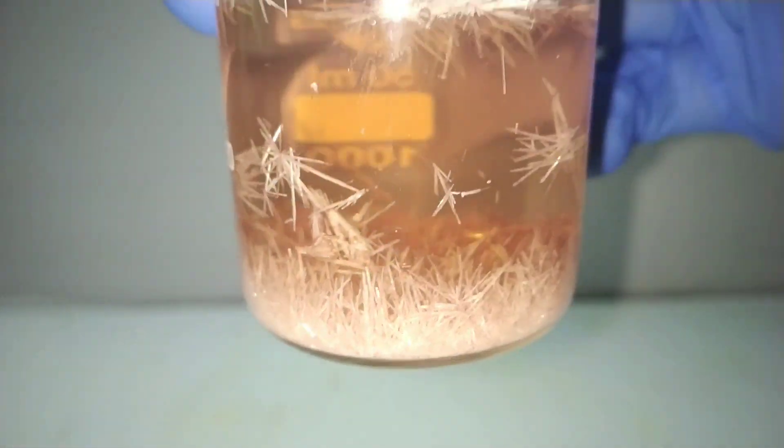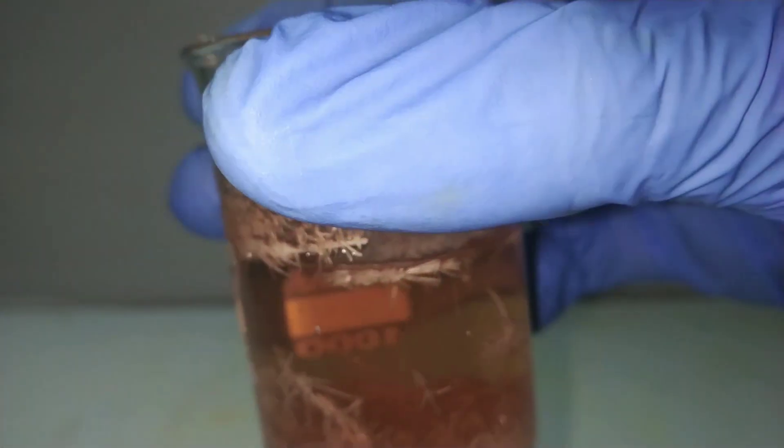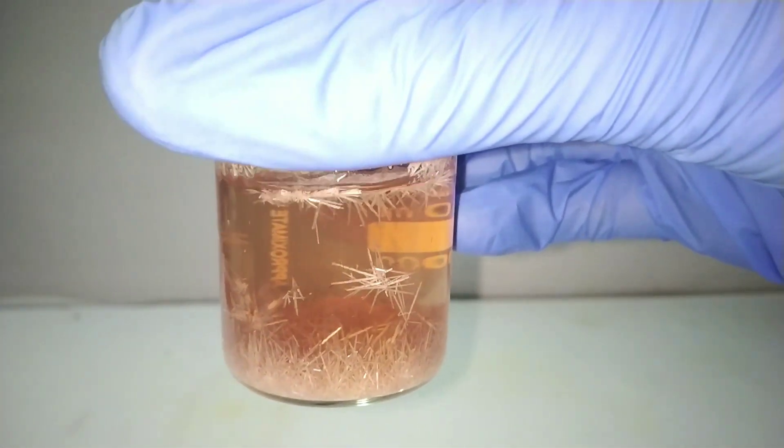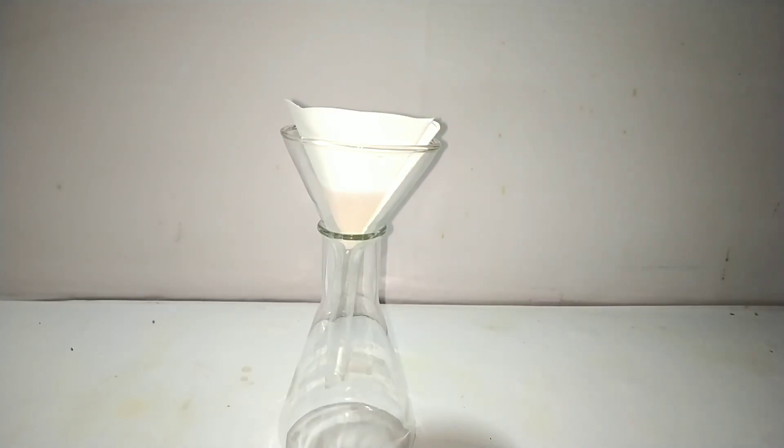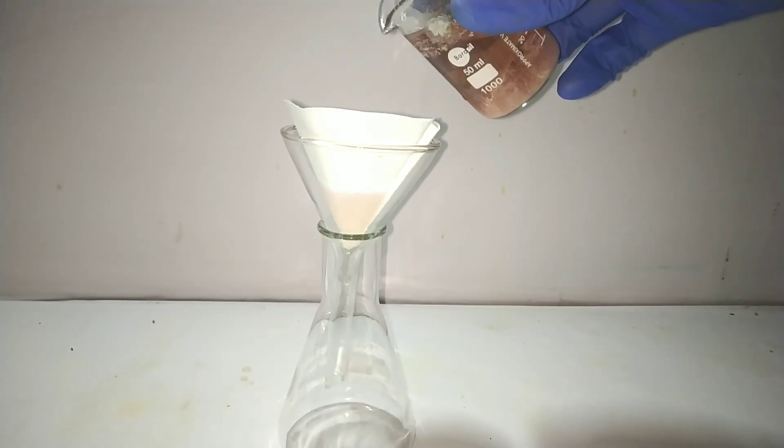It still had that dark color to it. Maybe I should have used some decolorizing carbon to make it white. I didn't care doing the secondary crystallization. So I filtered the solution to obtain the crystals.